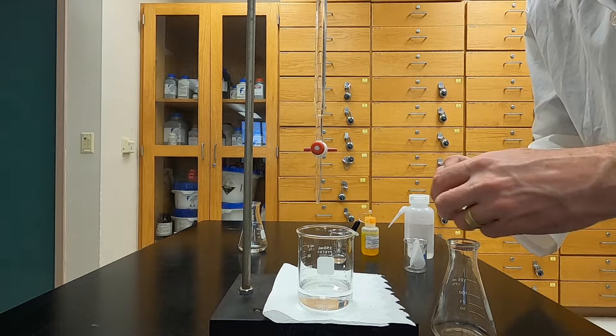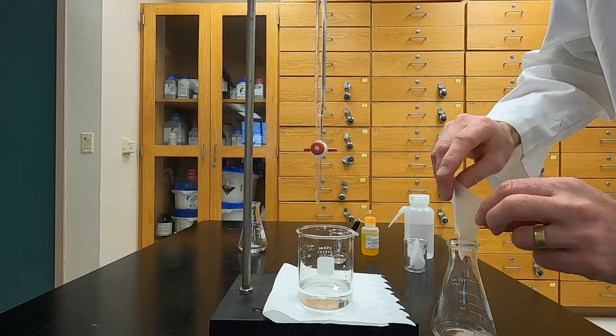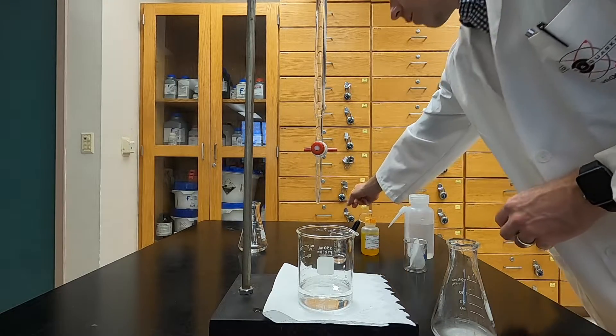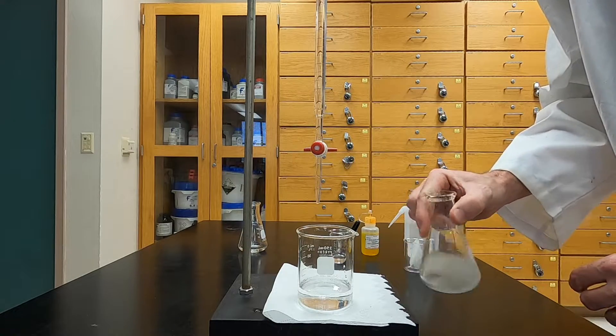To the flask you will then add a small amount of dextrin. I have the dextrin in a wax paper for easier transfer. I've dropped it into the garbage, not on the floor because I'm also responsible.